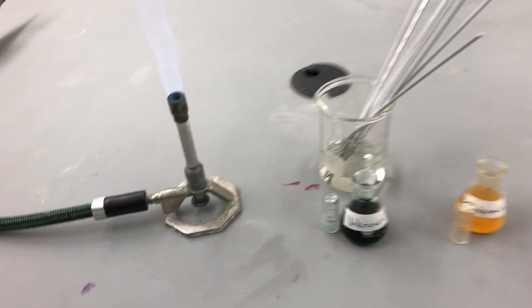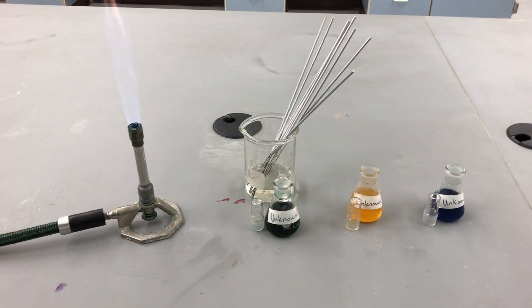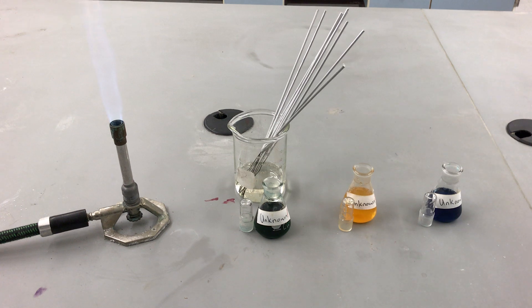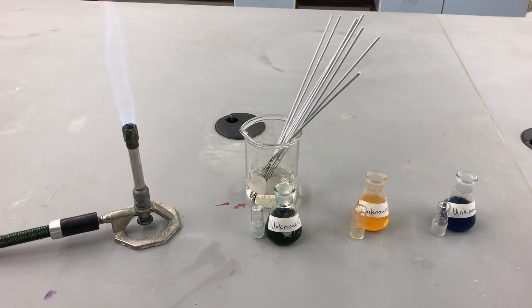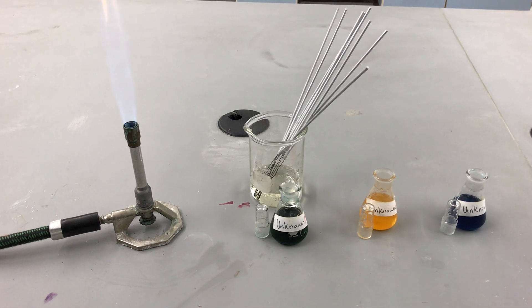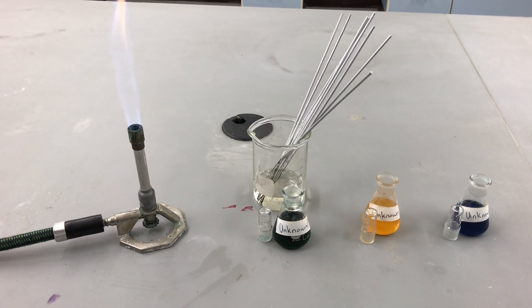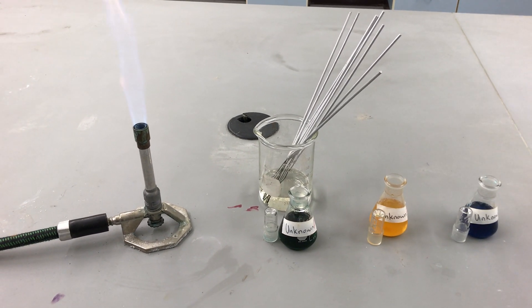Go back in for decontamination. At this point you should be able to determine the identity of our three unknowns by comparing them to our known samples. We're going to be recording this data on table two of your lab handout.